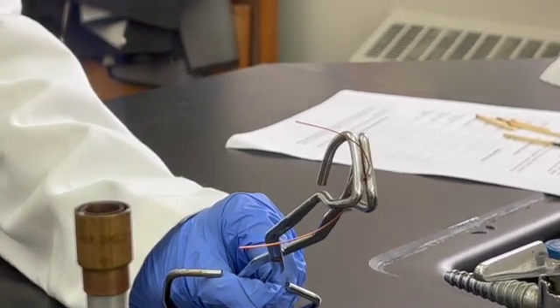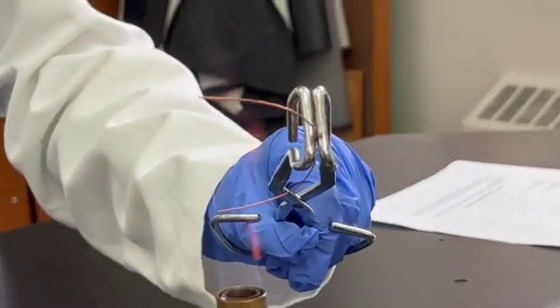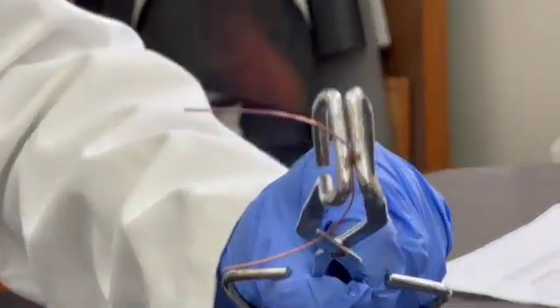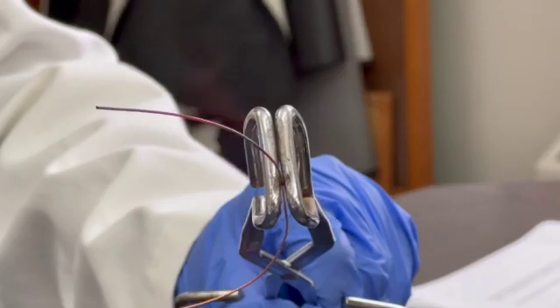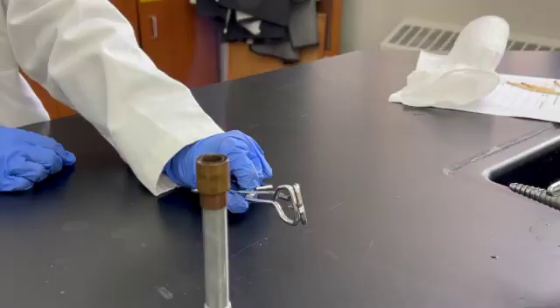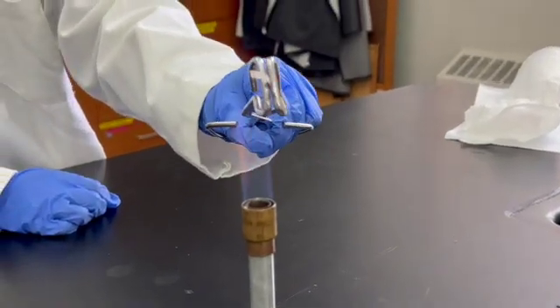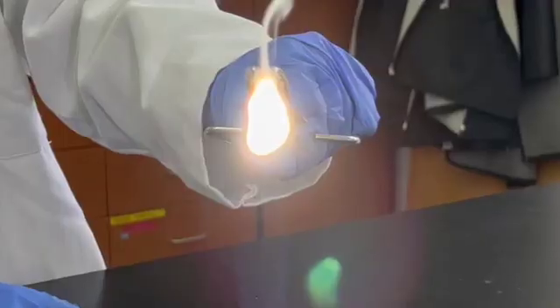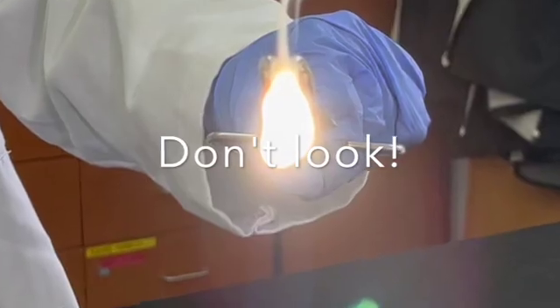Take a piece of copper and, using tongs, place it in the flame for a few seconds. Record your observations. Follow the same procedure for a strip of magnesium, but be aware that the reaction will be extremely bright. Try not to look directly at the reaction while it is happening.